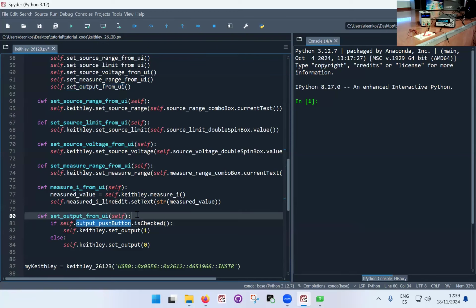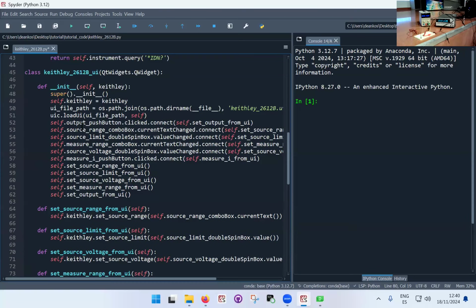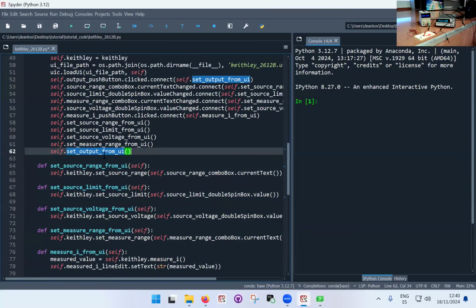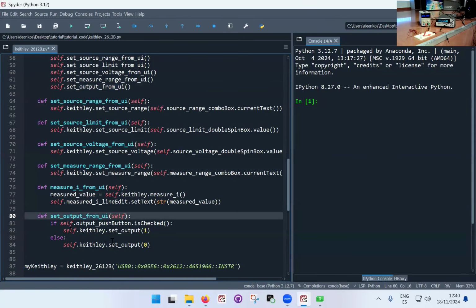I didn't press the button. So you have to press the button for it to work. I'm just executing as it is right now. It will connect all the buttons. It will get to this instruction and execute this function, and the function will look at the state of the button now. Is it checked or not? As it is when I run it the first time, it's always unchecked, always off. So it will set the output to 0. That's it. It's all that happens.